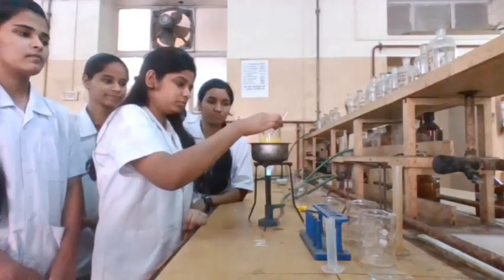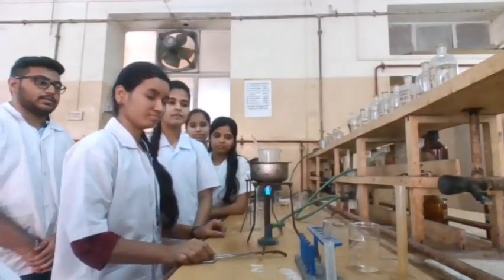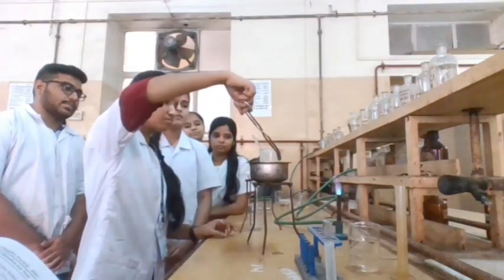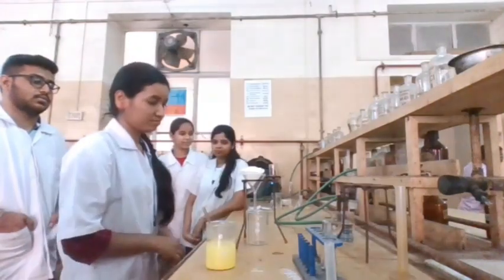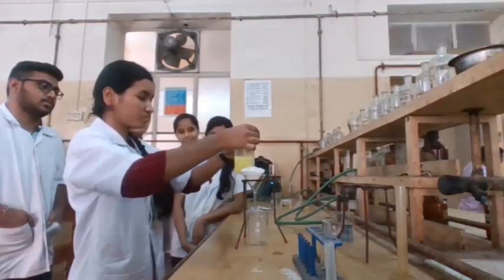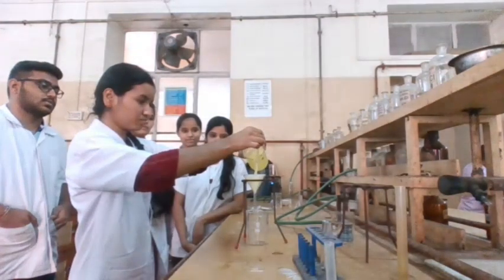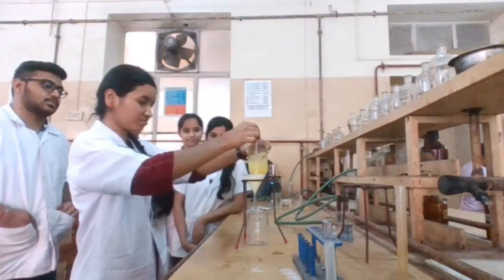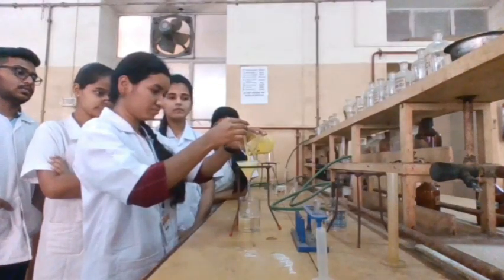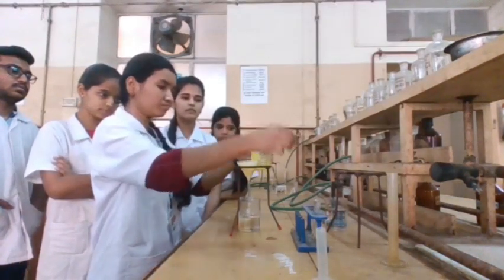Digest the precipitate in a hot water bath for about 25 to 30 minutes. After digestion, remove the beaker from the water bath. Then filter the solution through Whatman No. 41 filter paper by decantation method. Transfer the precipitate completely and wash 4 to 5 times with 1% ammonium nitrate.